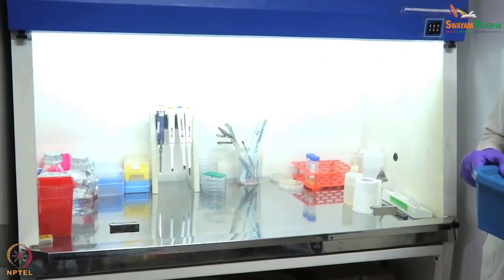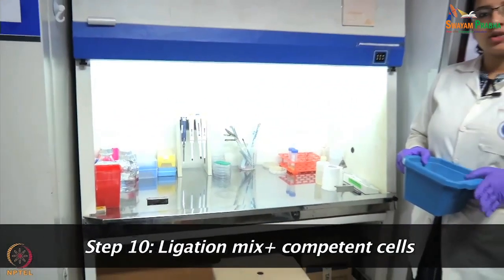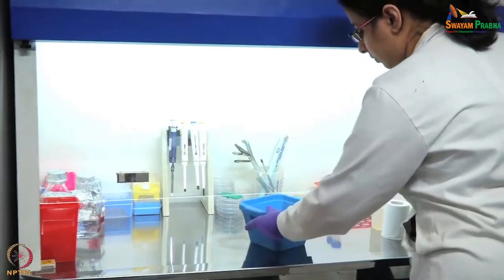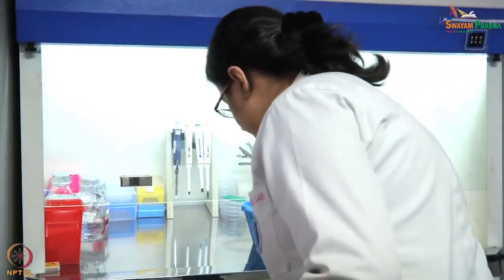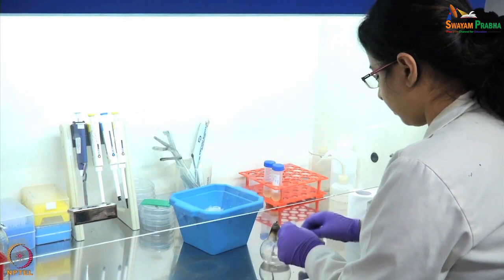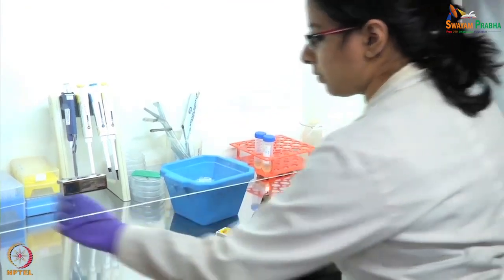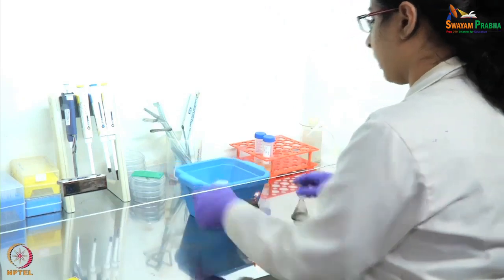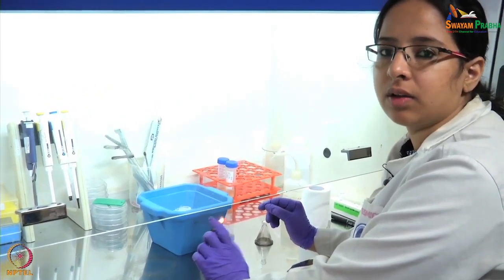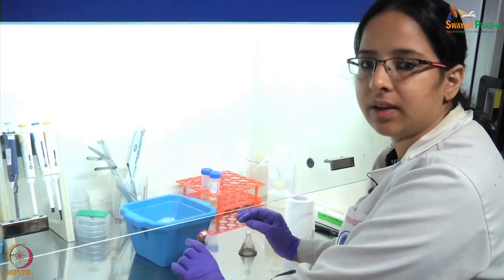After switching off the UV and switching on the fan and light, we carry out the transformation experiment. We have our ligated sample and we also keep a negative control — water. In all experiments we normally keep a negative control. We have our competent cells, the host cells into which we will introduce our recombinant molecule. In one tube we add our recombinant molecule; in the other tube we add the negative control water.